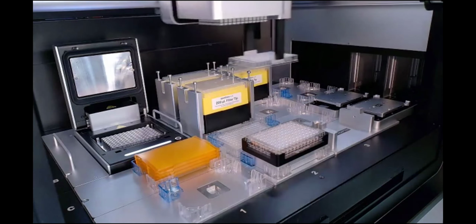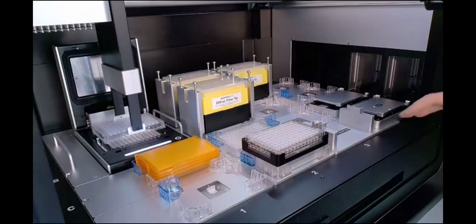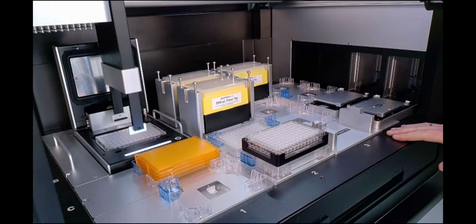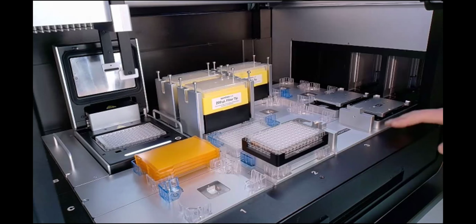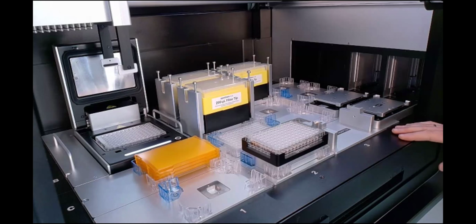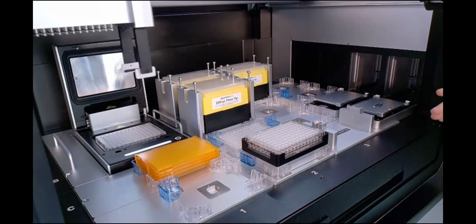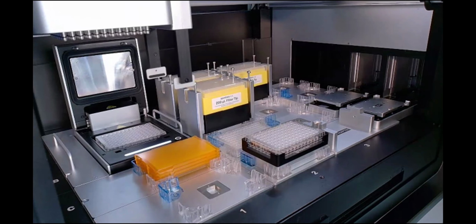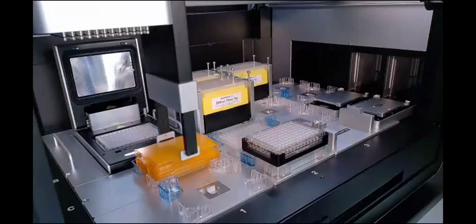As you see while it's retrieving them, the rightmost position, which is where the labware are coming out from, is called our column 4. This is only a gripper accessible position. So you can also use these positions just to store labware at. However, you will not be able to pipette to those positions. You'll have to use the gripper to move them.